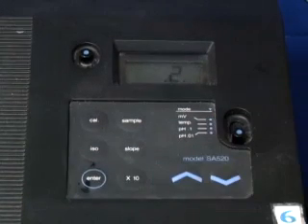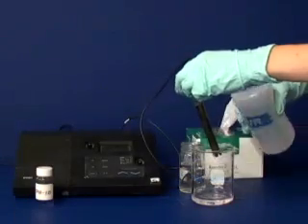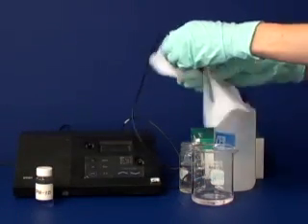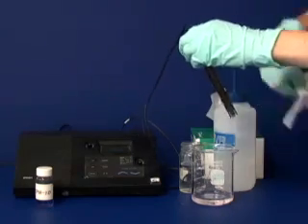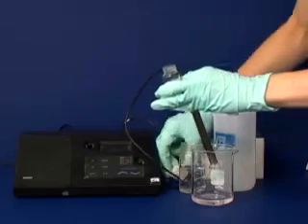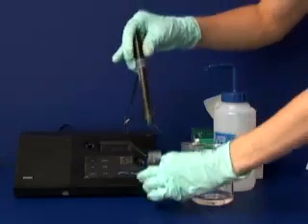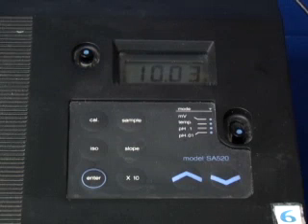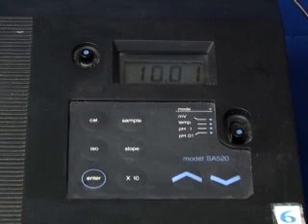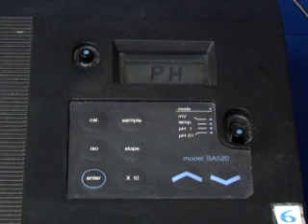The number 2 should then appear on the display. Rinse the probe with distilled water, blot it with a kimwipe, and place it into the second buffer. If your solution has an acidic pH, then use the 4.01 buffer. If it has a basic pH, use the 10.01 buffer. The display will alternate between 2 and the pH value of the solution. Wait until the display stabilizes and press enter. The letters pH will be displayed, indicating that the pH meter is now ready to take measurements.